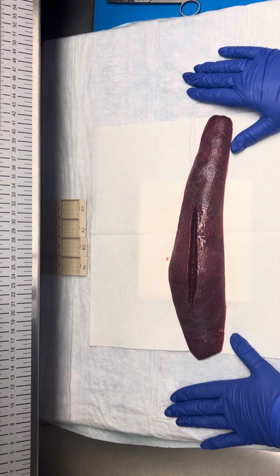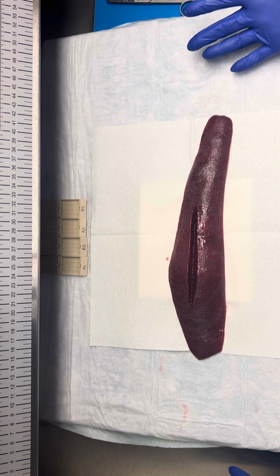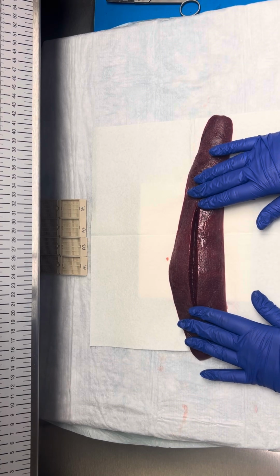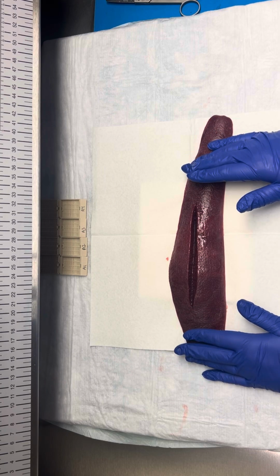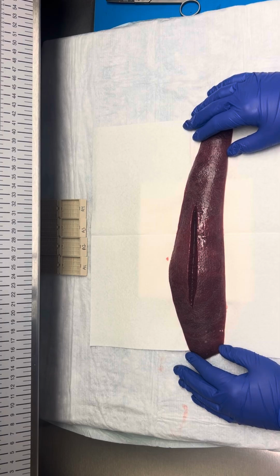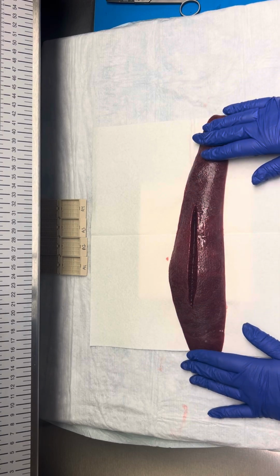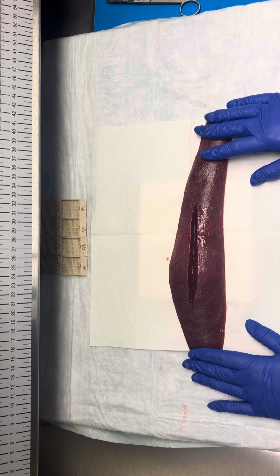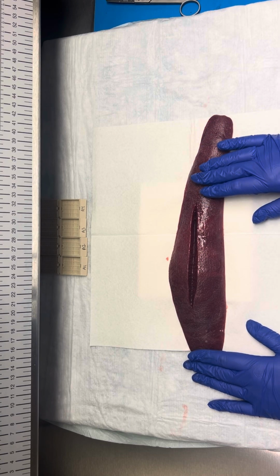So receiving a splenectomy for trauma or for a laceration, really the only thing we're trying to document is our capsular surface and anything that we see here. On our serial sections for our cut surface, we're not expecting to see anything because we're just receiving this for trauma. So if this were the specimen that we received, taking a gross photo at this point would be really helpful, especially if this was for a medical legal case.